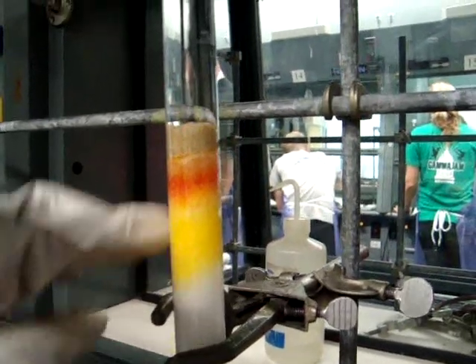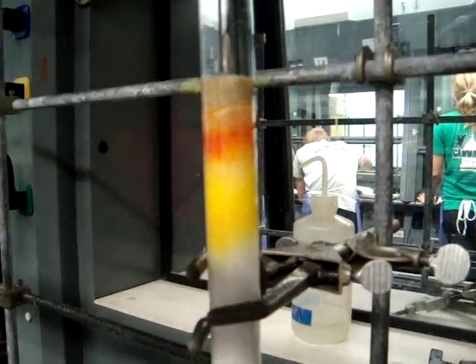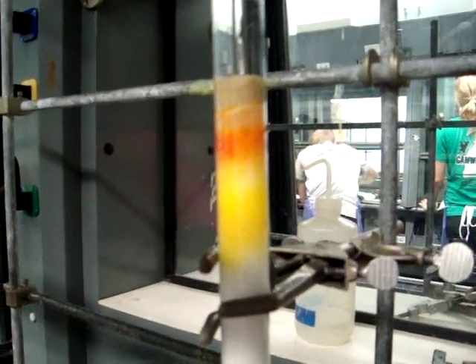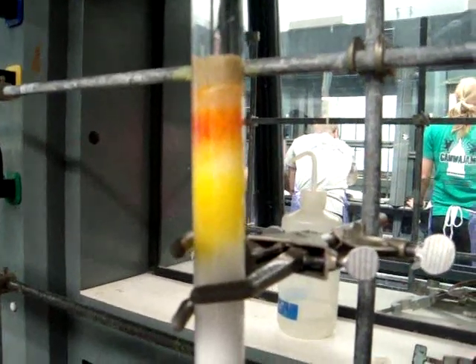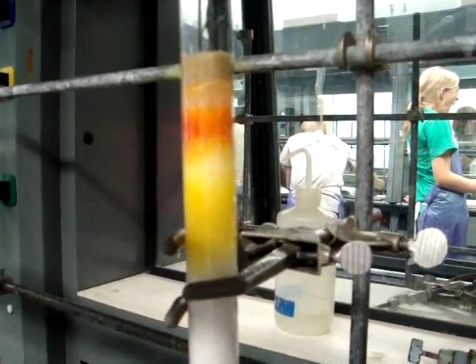This is the mobile phase, and it is eluting to the bottom where we will remove it in a moment. As you can see, the band is moving down the column. The yellow band is the beta carotene and the red band is the lycopene.